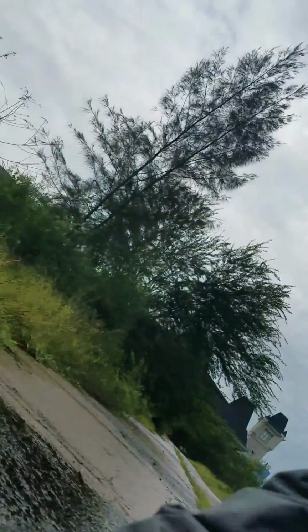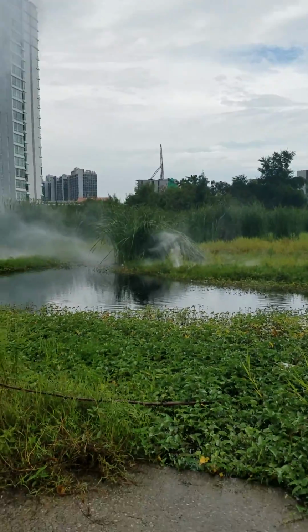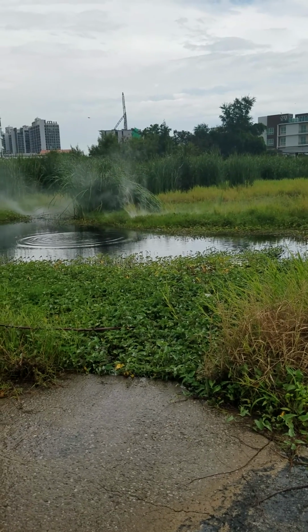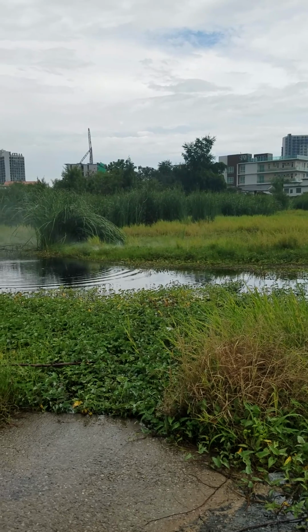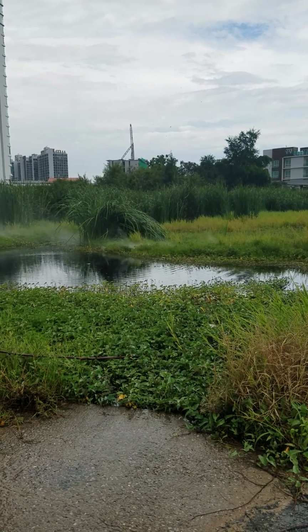Number two. Sorry for that waviness. Here's number two. Just have to get a little bit of time to, here it's floating. You can just barely see it there on the surface. I hope the police don't come.